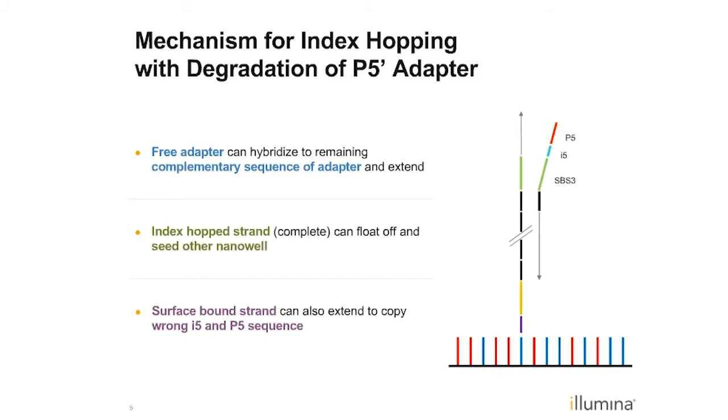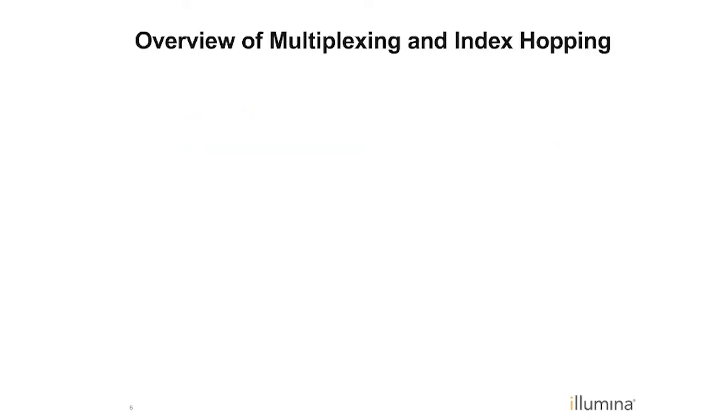So here's an example of one of the mechanisms that we believe is happening during an index hopping event. Essentially, index hopping leads to what you might think of as a molecular recombination event between the two ends of two different molecules. And one of the biggest drivers, and you'll see this as a theme throughout the presentation, is that free adapters can cause a lot of these effects. So if you have free adapter, as shown on the right here, this free adapter could potentially bind to a strand inside of a cluster and basically be primed this way or that way to lead to mispriming events or a hopping event. These strands can also float off and go seed other wells, and you can see that both the surface strand and the incoming strand could be potentially misprimed during these types of mechanisms.